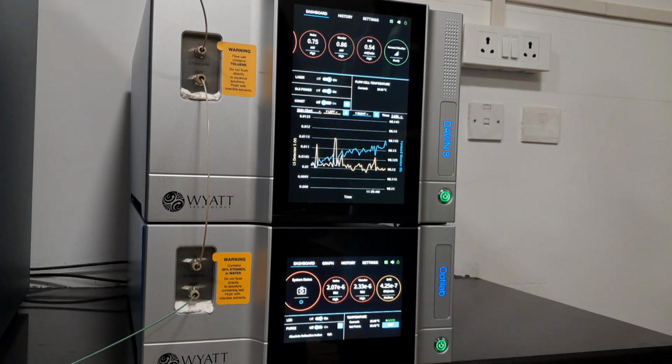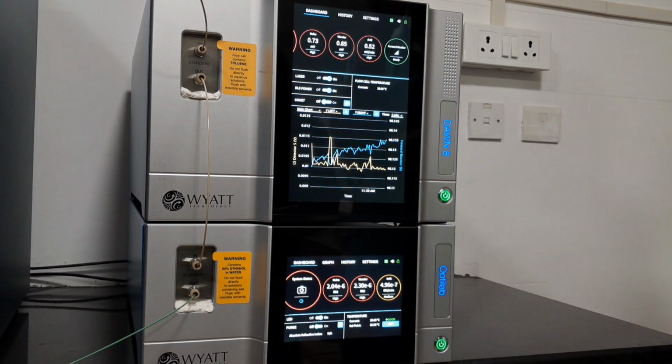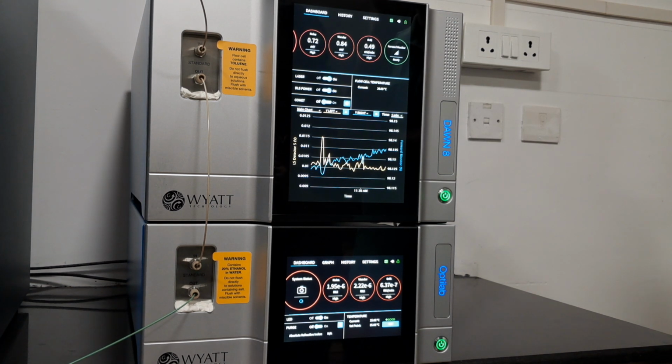That we have to work on as a separate case. Once we have the standard in our hand, we can see whether the instrument is fine. He is only the field engineer, so whatever your questions are regarding your sample, come with your own.